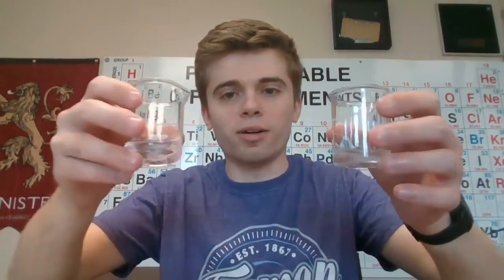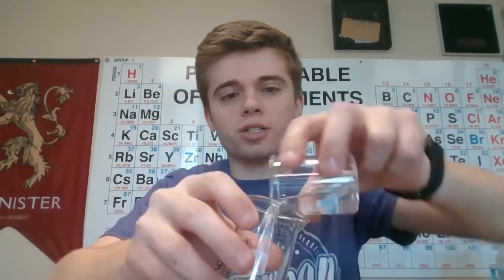So as soon as I dump them in, go ahead and start timing it, and we're going to record that number. So remember, you want to look for whenever it turns blue. So we're going to hold it, keep watching, keep timing. Oh, it turned blue. That was really fast. So make sure you record that time. Feel free to rewind if you need to. Record that, and then we'll come back and we'll do trial 3.